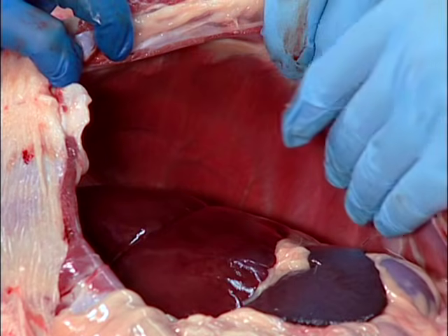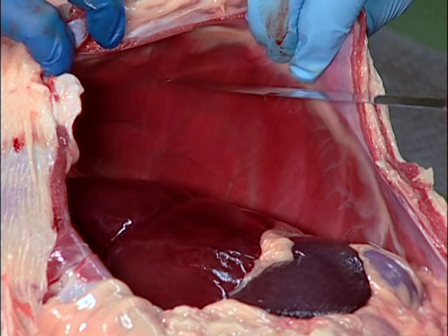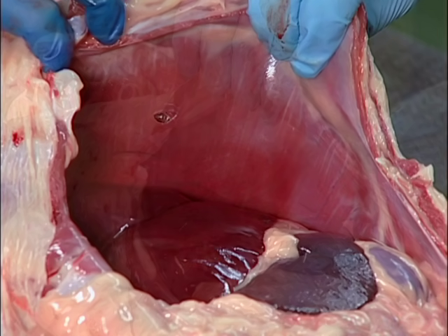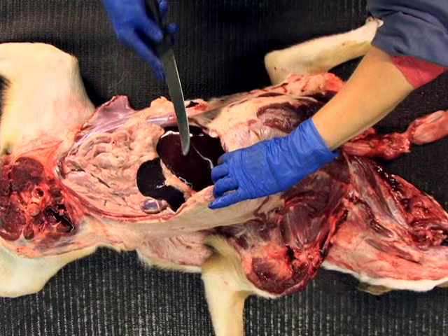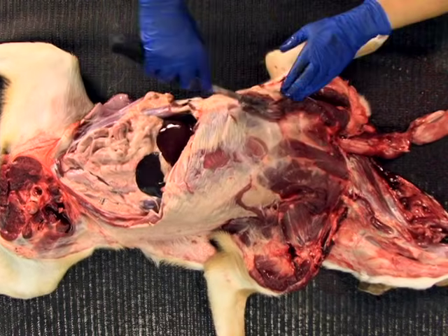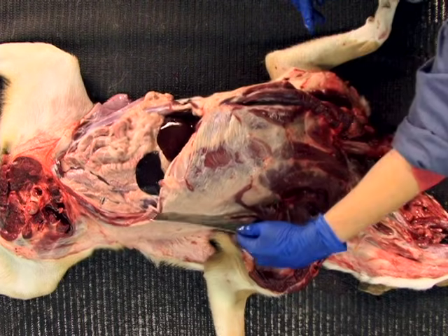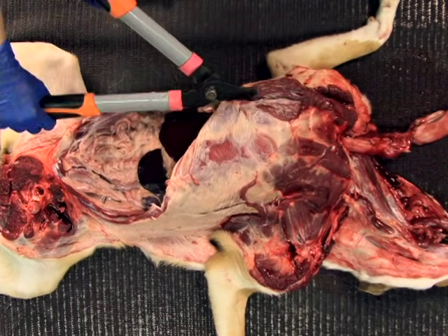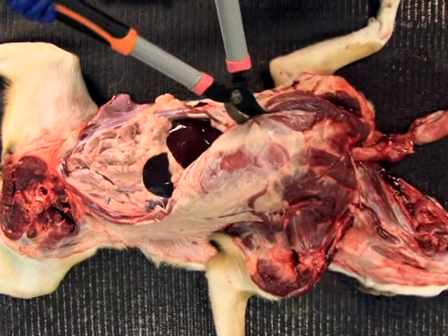Before opening the thorax, first assess the presence of negative pressure in the thoracic cavity by evaluating the tonus of the diaphragm and by observing diaphragmatic collapse after perforation. In addition, the sound of inrushing air may be heard. After that, make a semilunar cut along the edge of the rib cage to detach the diaphragm from the left side of the thoracic wall. Using bone cutters, cut the costal cartilages close to the sternum and cut away any remaining soft tissue attachments.